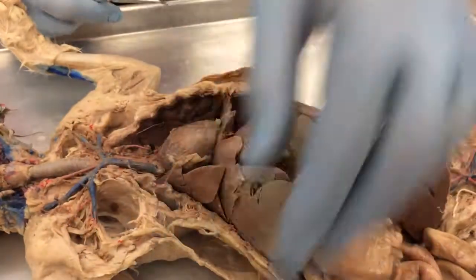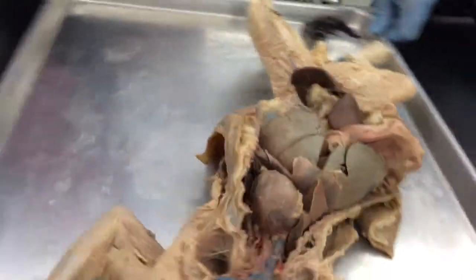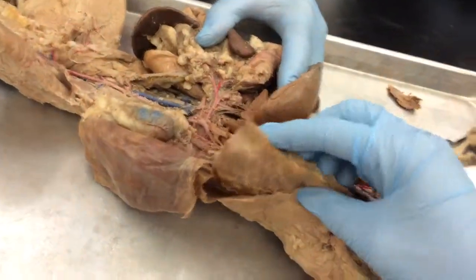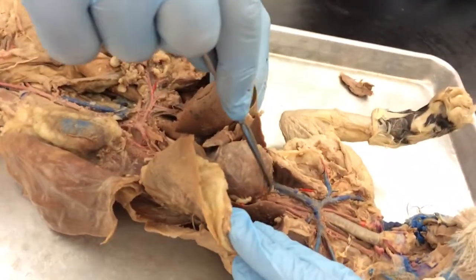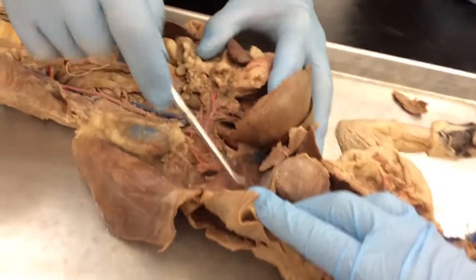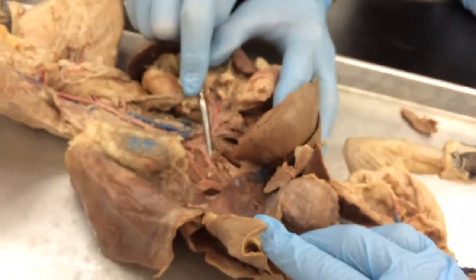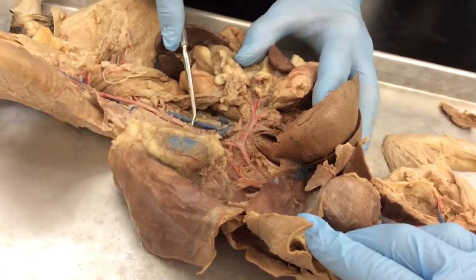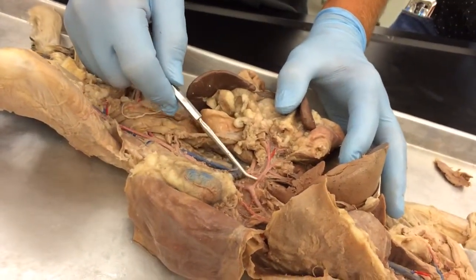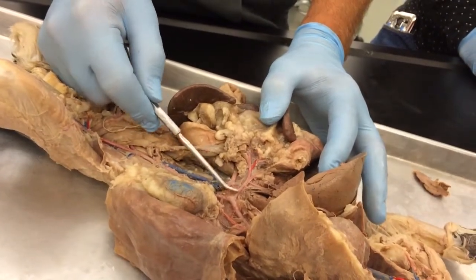Okay. Now we're going to go down into the abdominal cavity. I think I need to flip this so that I can see it. So the aorta wraps around the top of the heart and comes down through the diaphragm, and now we have the abdominal aorta. It continues as the abdominal aorta all the way to here. The first branch off the abdominal aorta is this artery called the celiac artery or celiac trunk. Shows up great right here.